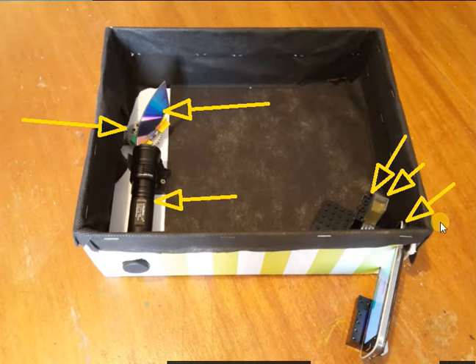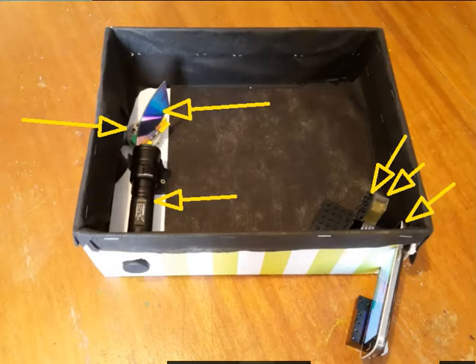Different diffraction that you'll achieve from your DVD and so on. So there's a bit of fiddling around needed, but it works pretty well.